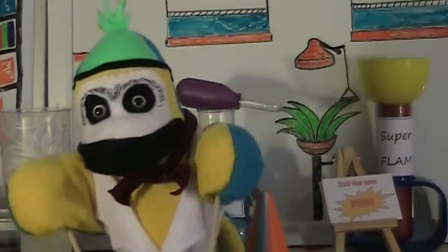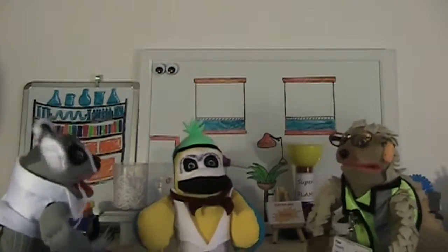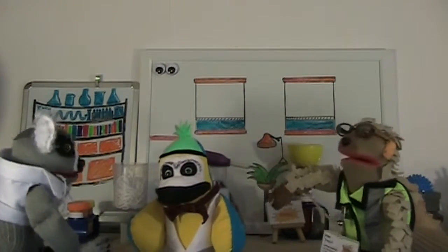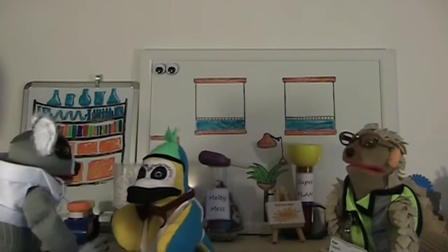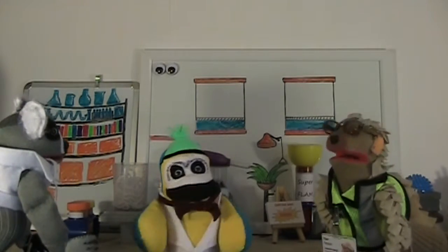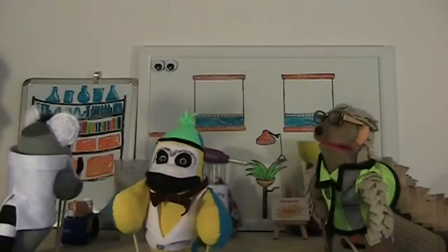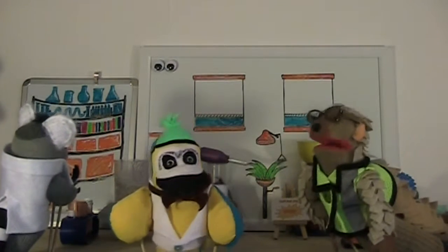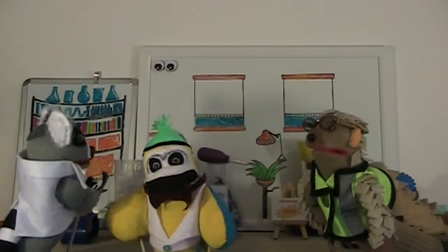Of course. Science. I use science to make these noodles. Want some? Did you make these over there? Yes. No, no. There's no food or drinks allowed in the laboratory. Or drinks? What about my orange juice? No, not orange juice. Oh well.